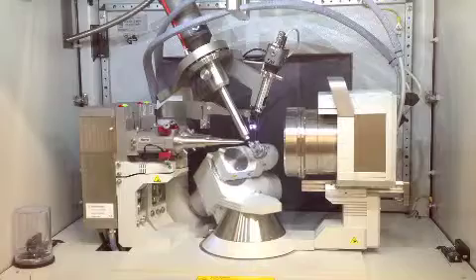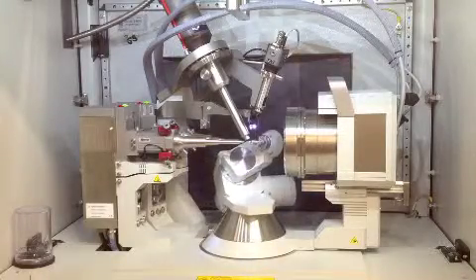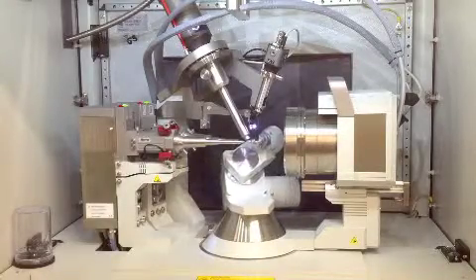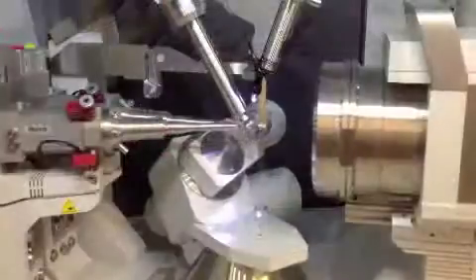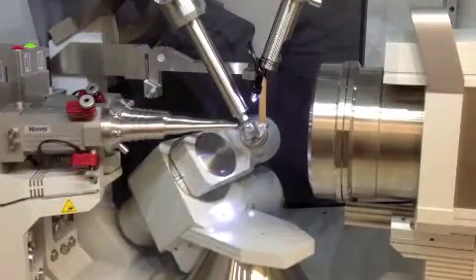This pattern looks like a collection of dots in different positions and intensities. It can be used to calculate what's inside the crystal.